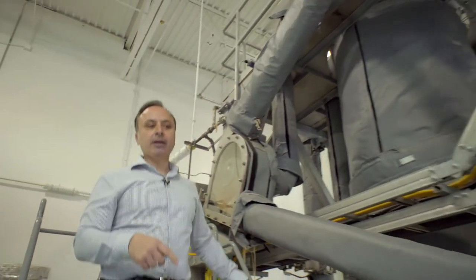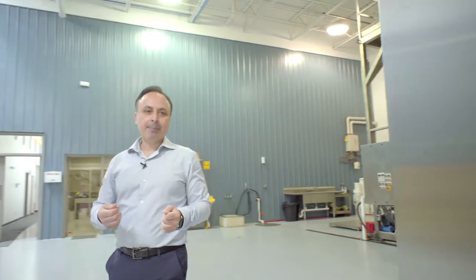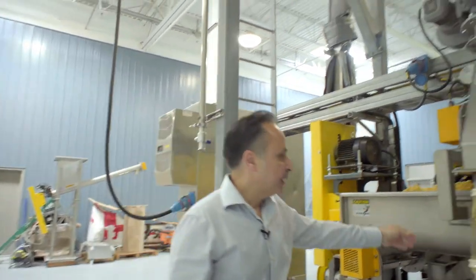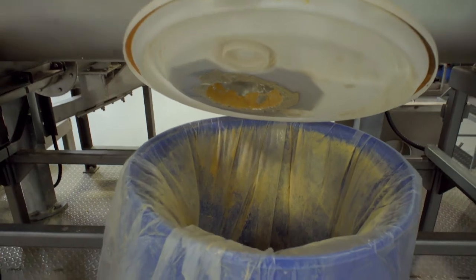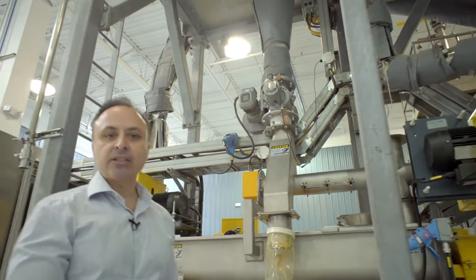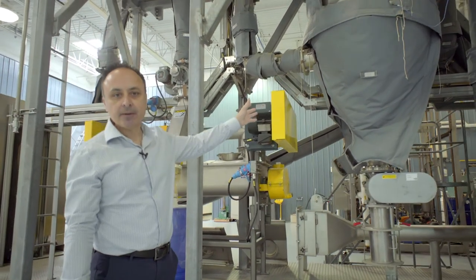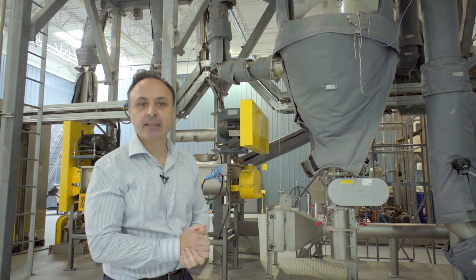The product out of this system is typically a fine powder. The product discharge comes out of the cyclone and discharges into a barrel. Fine material comes in, and the material that entered the mixer and discharged into the cyclone was out in a couple of seconds — a very important feature for thermally sensitive products. We also have a dust collector here. The dust collector functions as an emission control device, but can also serve as a secondary collection point.